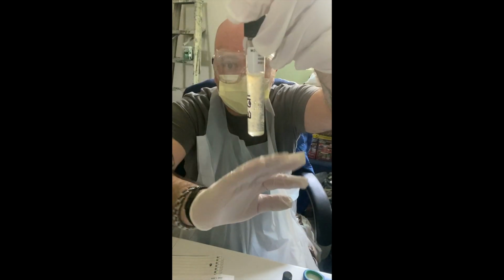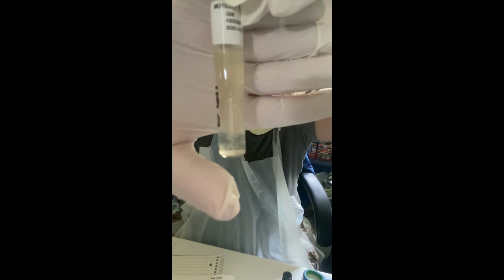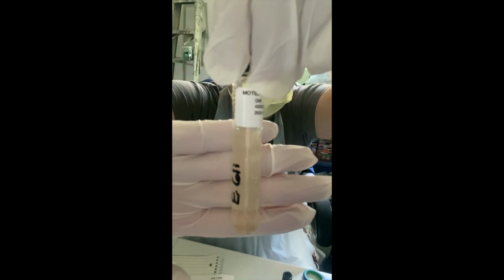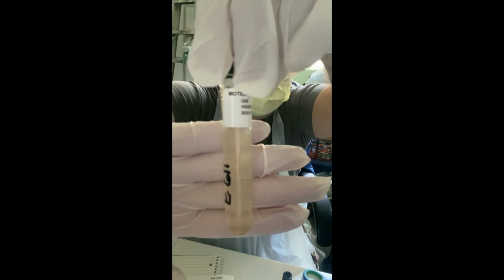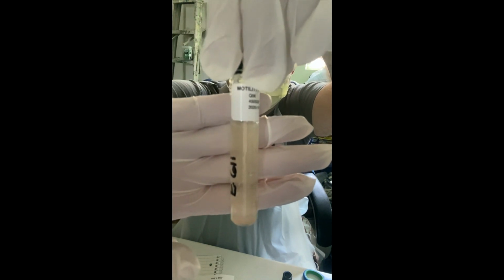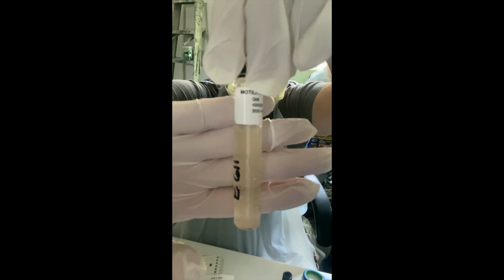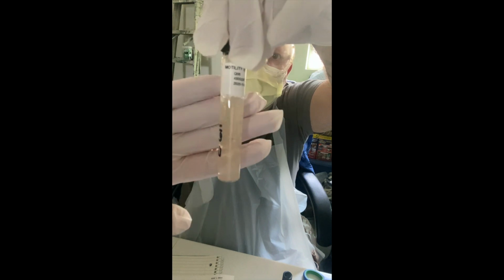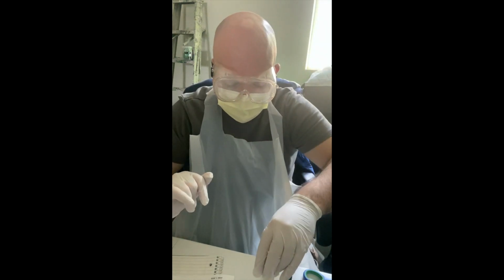So we're going to start with the motility agar for the E. coli. And hopefully you can see here, I'm just going to put it against my glove. There definitely is quite a bit of turbidity here in comparison to what it was when I started the process on Wednesday, June 3rd. So this is much more turbid. So I would definitely say here that for the E. coli, it's motility positive, if you will. The flagella are there and have moved around the motility agar. You can see quite a bit of turbidity, kind of like the top half of the motility agar.